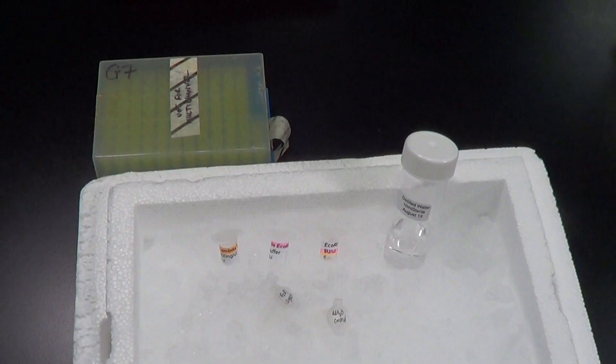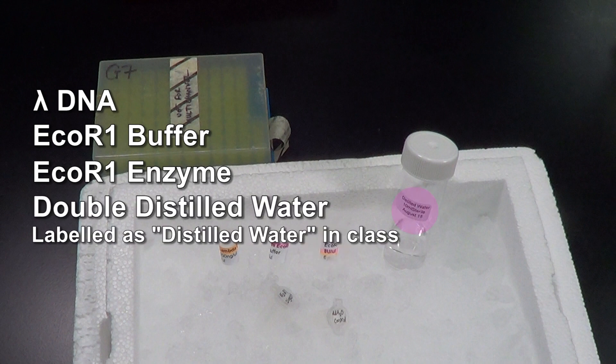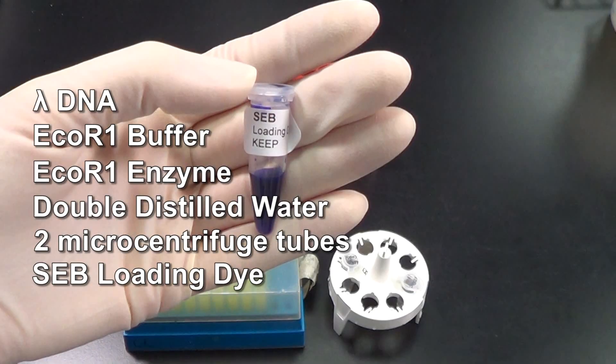The following reagents were used in this demonstration: Lambda DNA, EcoR1 buffer, EcoR1 enzyme, double distilled water, two sterile microcentrifuge tubes, and SEB loading dye.